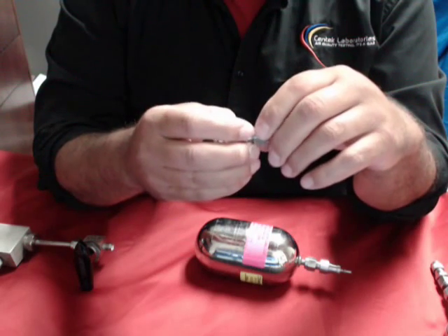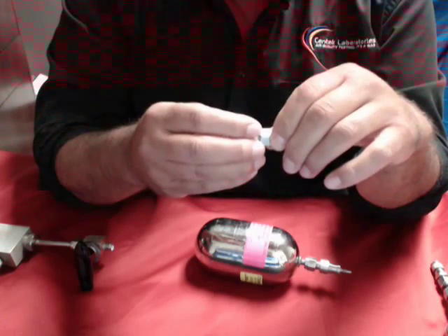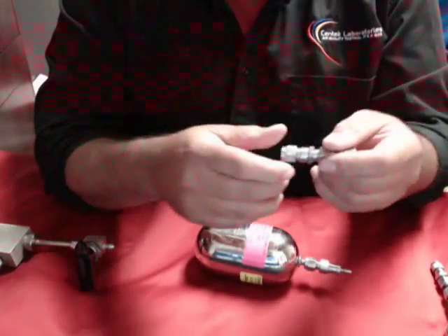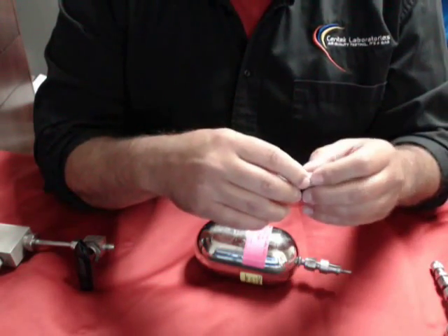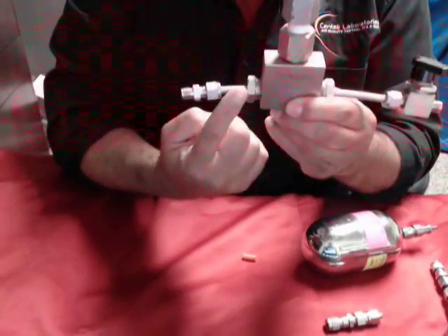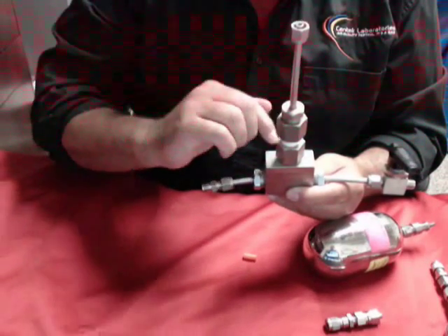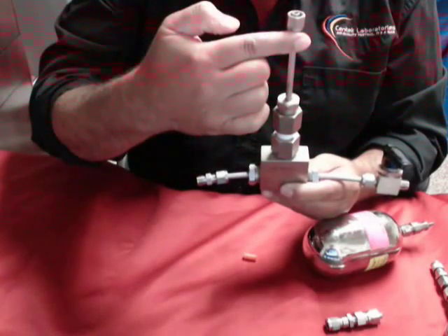The distance of your pipe is the most important part. If you are having lines that are 3 to 4 feet long from your sampling source or your large pipe, it could cause another bias in your results. If the main pipe is coming in here, you don't want a pipe that's 3, 4, or 5 feet out, because the actual source has to travel such a distance that we're going to have an issue.